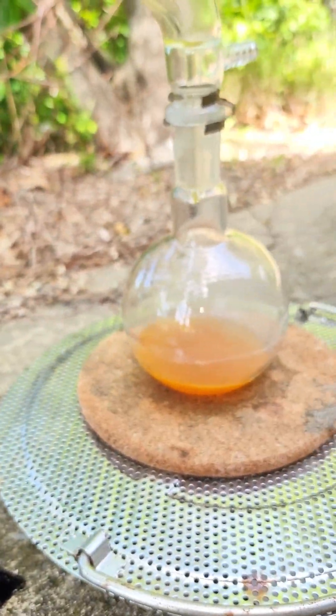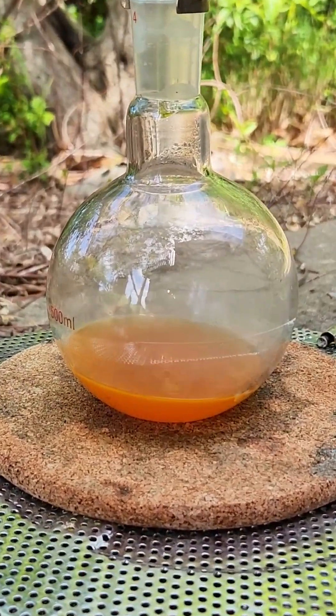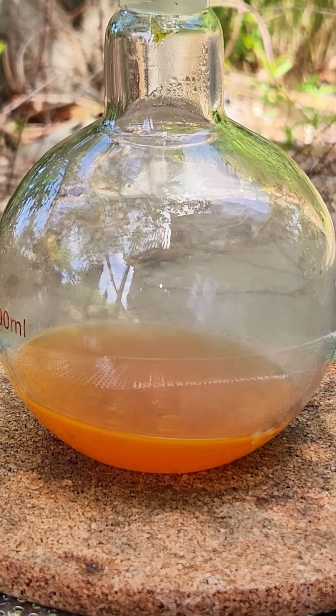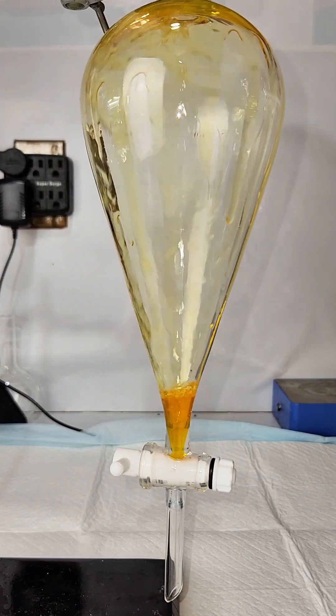After about 30 minutes, no more benzene is distilling, so I cut the heat, disconnect my apparatus, and bring my benzene inside to further process it.